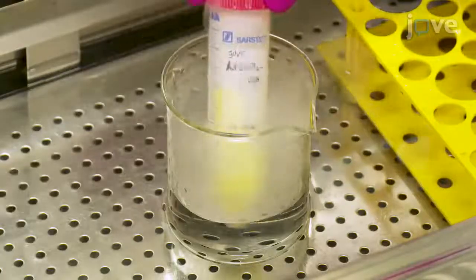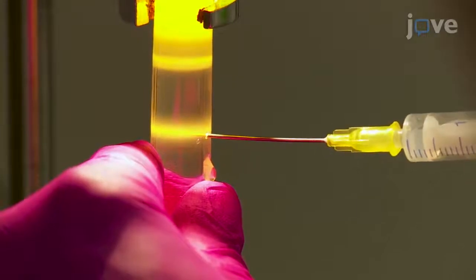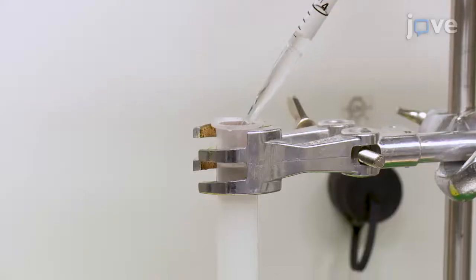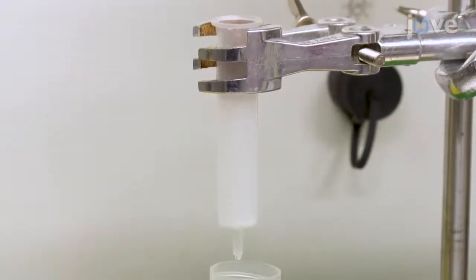This method can help to answer key questions in the field of gene therapy, oncology, and genetic vaccination. It facilitates understanding and modulating of vector-host interactions of adenovirus gene transfer vectors, the most frequently used vector type in clinical trials up to date.